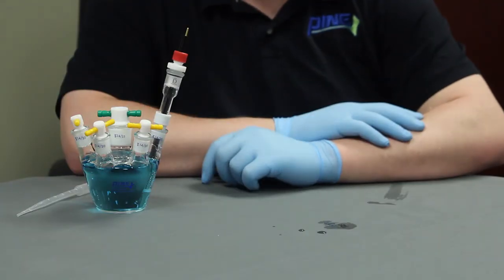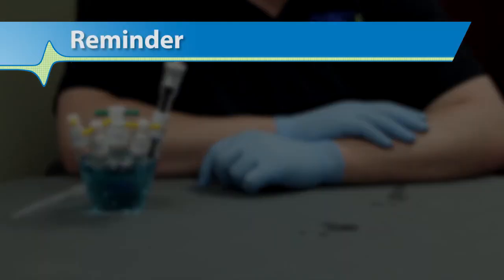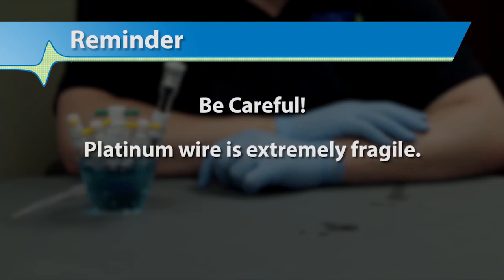Something I do want to remind all users about is to be very cautious. Platinum wire is extremely fragile. Avoid the temptation to play with the coils, to move them, to bend them, because there is a risk that the platinum wire could break when overextended.